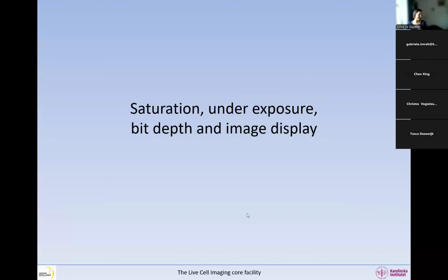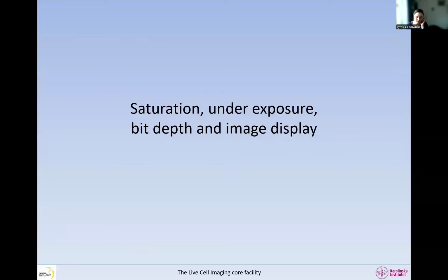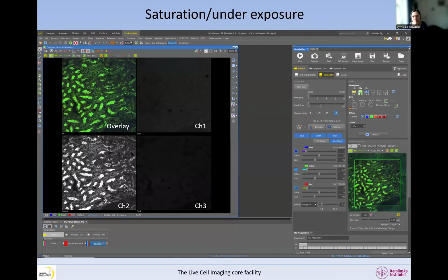Okay. So today we're going to talk about saturation, underexposure, bit depth, and image display. So now we're sort of moving away a little bit from the hardware, even though we'll come back a bit later today. And then we're going into the software really of your microscope. So saturation and underexposure. We have this in this image that we have. All this is done with the NIS-Elements, the Nikon NIS-Elements, but the same thing exactly applies to your microscope.